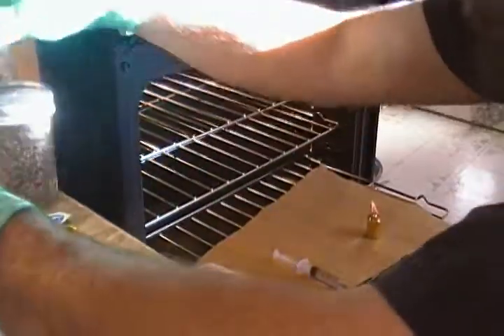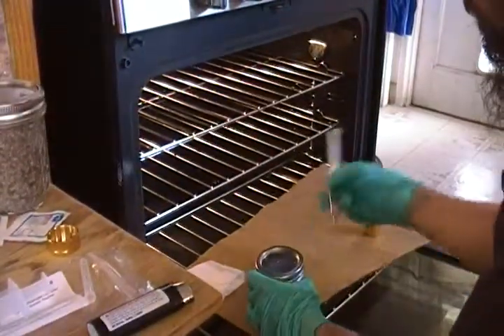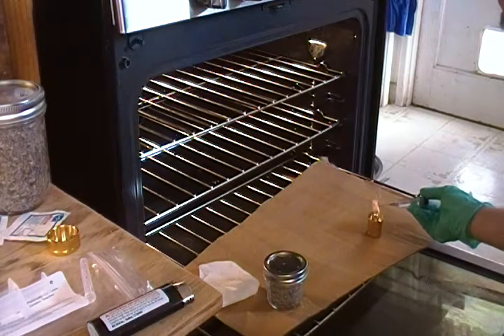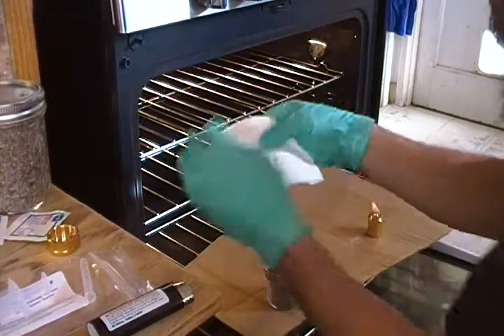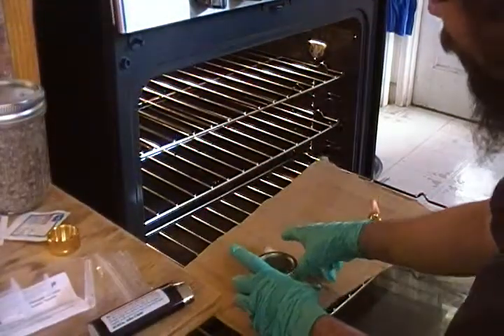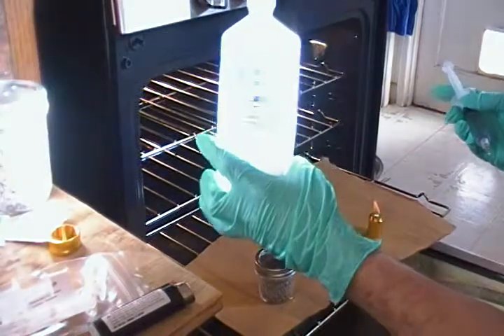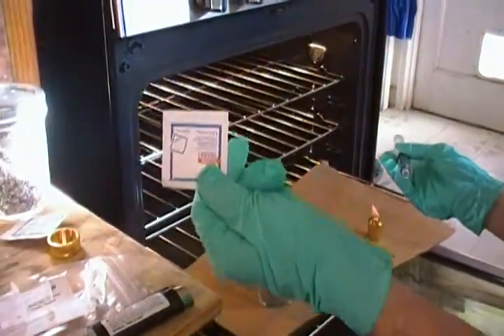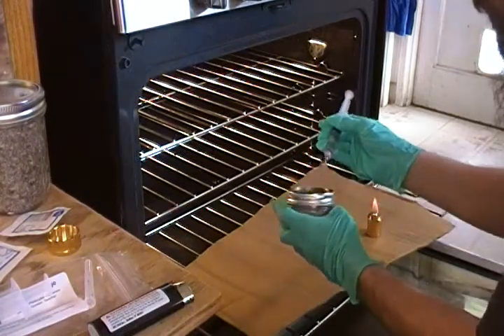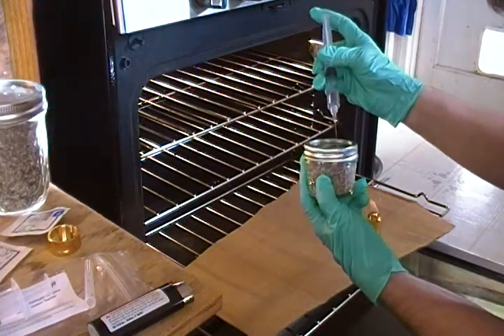Also make sure your jars are all tight. When they're in the steamer, leave the lids just a little bit loose. Flame sterilize the tip again between jars. Alcohol is your best friend here — use denatured alcohol. It's not drinkable but it'll still work. You can also use alcohol swabs or pads, but they're too small for how I like to do it.